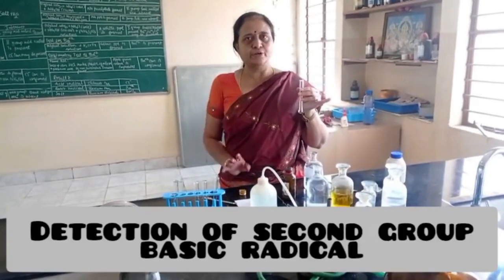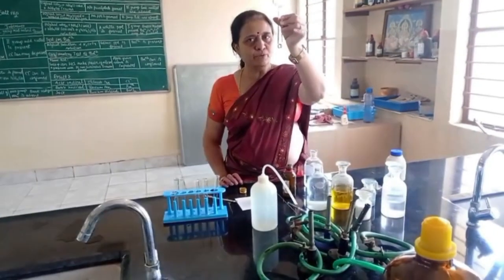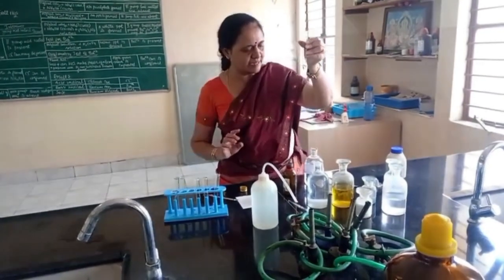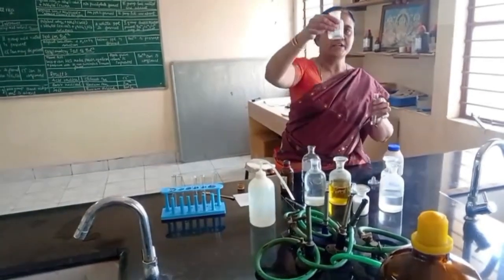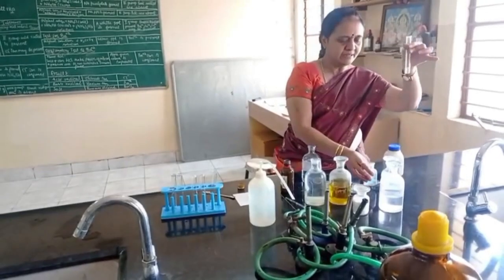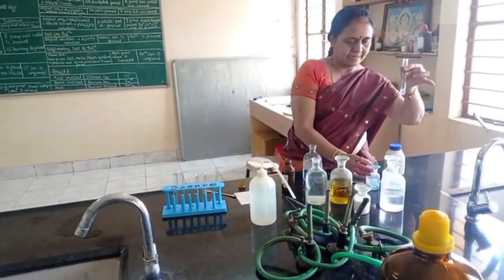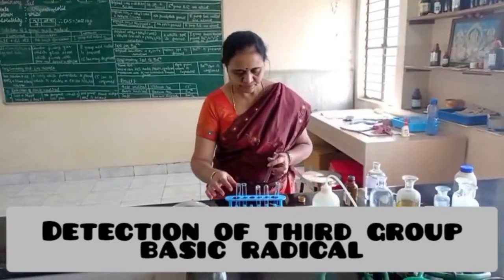Next, I move to second group basic radical. For second group basic radical, I am taking original solution, dilute HCl. For this, I am adding H2S. No precipitate. Second group basic radical absent. Then I move to third group.